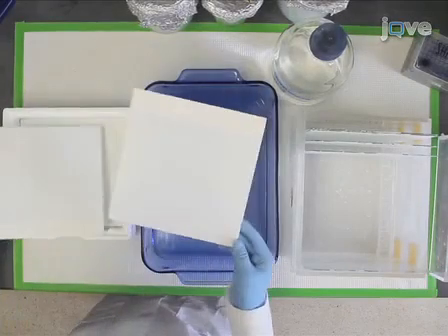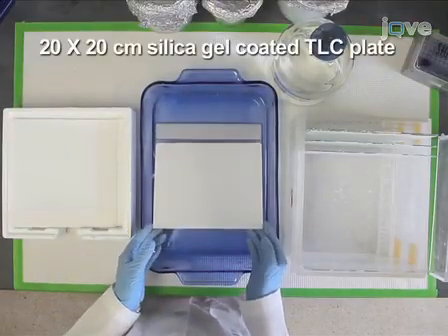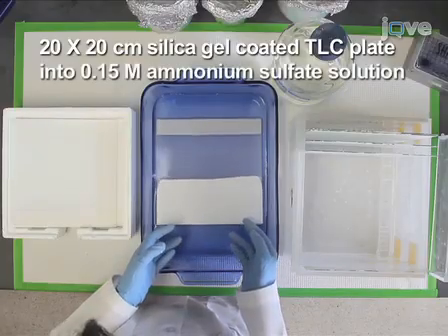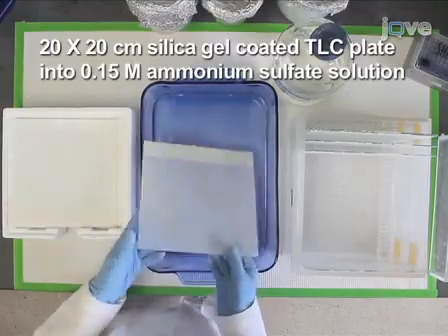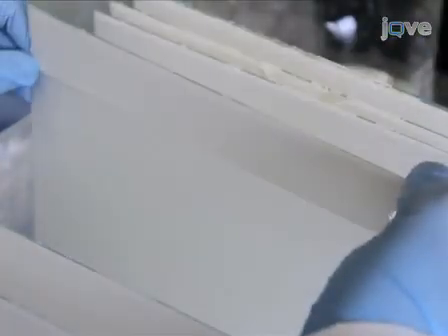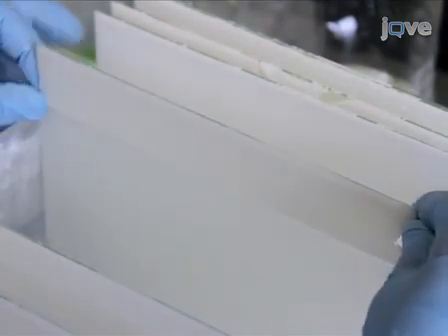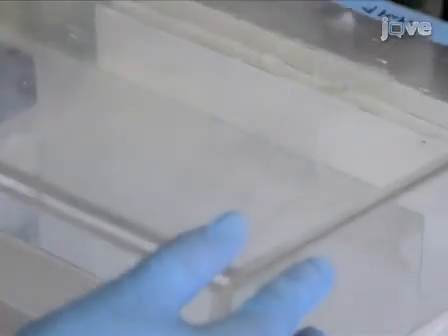To prepare TLC plates, submerge a 20 by 20 cm silica gel-coated TLC plate with loading strip into 0.15 molar ammonium sulfate solution. After submerging for 30 seconds, dry the plate for at least 2 days in a covered container. During activation, the sublimation of ammonium leaves behind sulfuric acid, which protonates phosphatidylglycerol necessary for its separation from other glycerolipids.